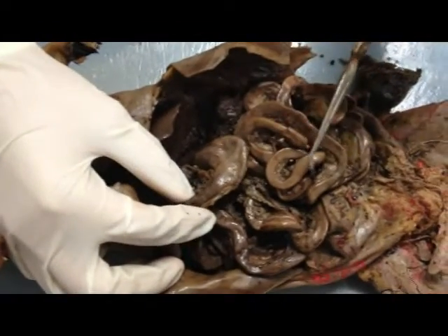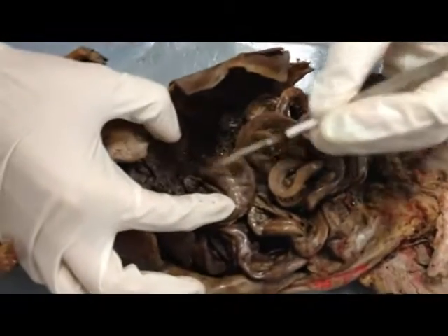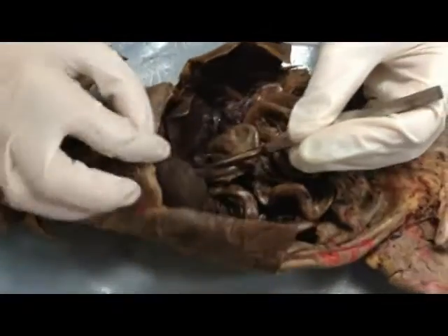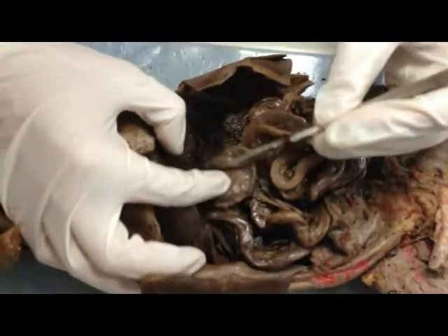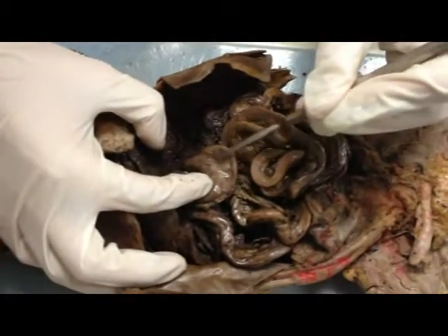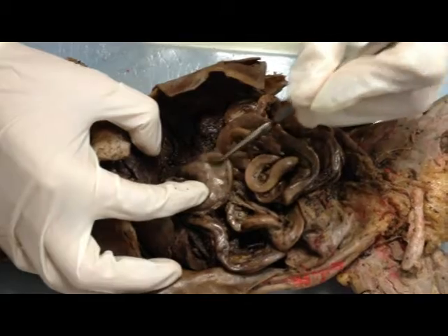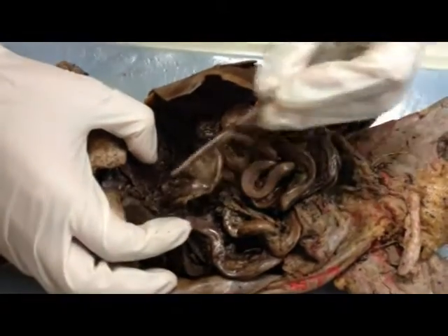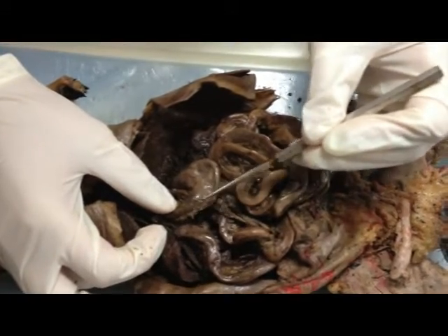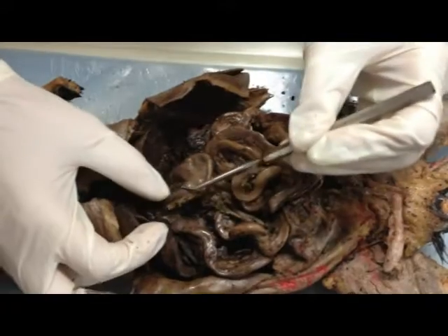So you have the cardiac portion — this area right here because it would go up near the heart, so this right here is the cardiac portion. You have the fundus, which is this fat part right here. You have the pyloric region, which is this one right here — right before it goes into the small intestines.